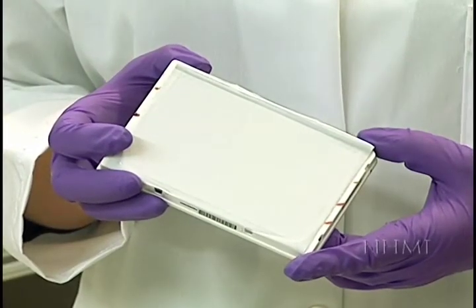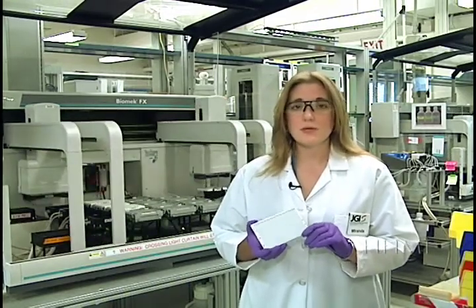Here is our 384-well plate that's been sitting on the thermocycler for a while. Inside this plate are millions of copies of Sanger fragments. There are also millions of lysed E. coli cells and unused reagents. Before we can proceed, we have to separate the Sanger fragments from the other debris in the wells.